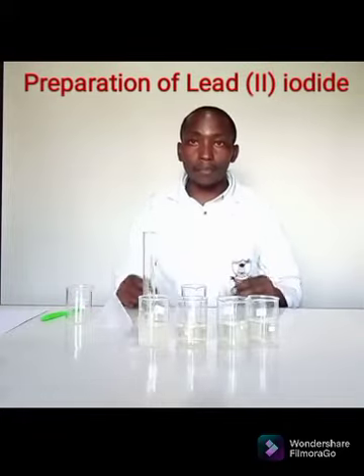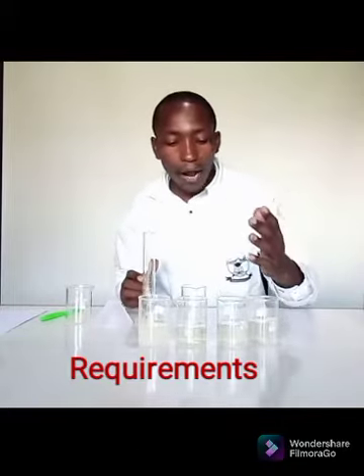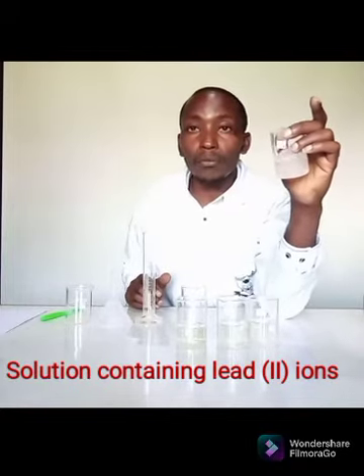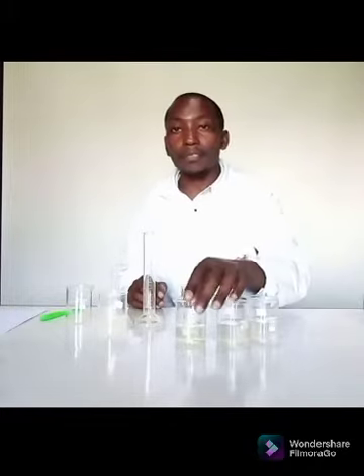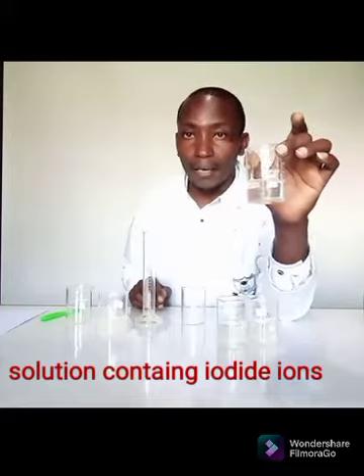Lead II iodide is an insoluble salt. So what exactly do I need? I need two solutions. I'm going to have one solution here that will bring in the lead II ion. I'm going to have another solution here that will give me the iodide ions.